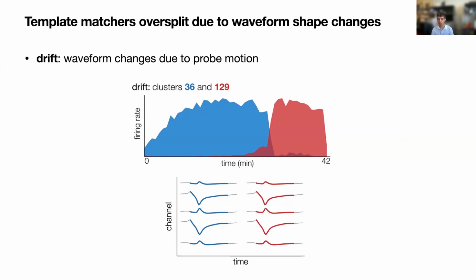One reason is drift. So even though the actual action potential of the unit isn't changing biologically, the way that gets recorded by the probe changes due to changes in the relative position of the probe. So for example, in a real recording, you might see that two units with very similar waveforms, one of them has a firing rate that drops off at a certain point in the recording, and its firing essentially gets taken over by a different unit.